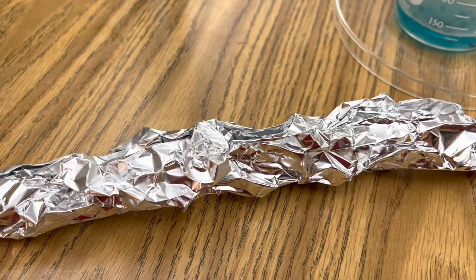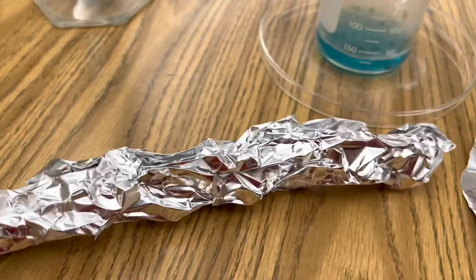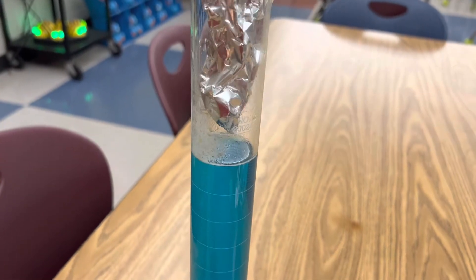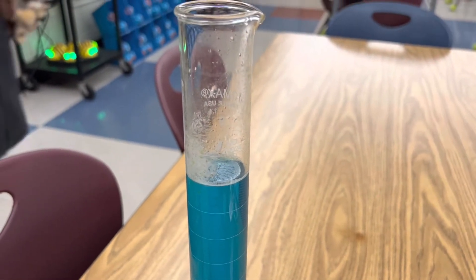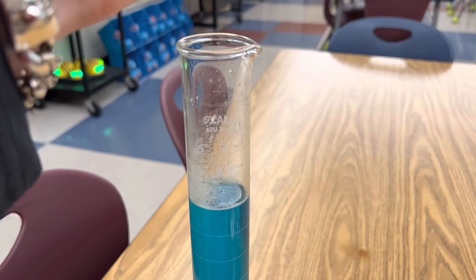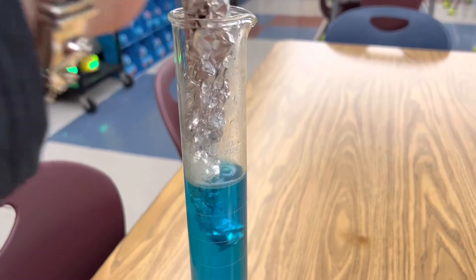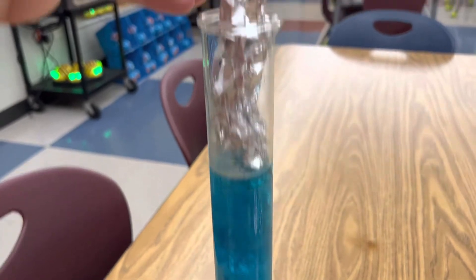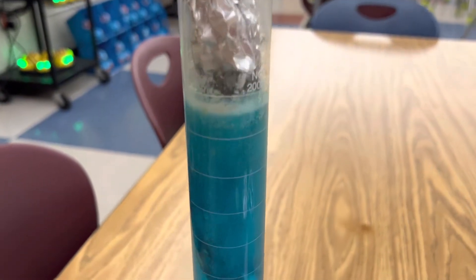The next way you can demonstrate the same reaction is by taking your longer piece of aluminum foil and simply lowering it into your graduated cylinder of copper chloride. I'm going to put it about halfway in so you can see the difference between both halves.